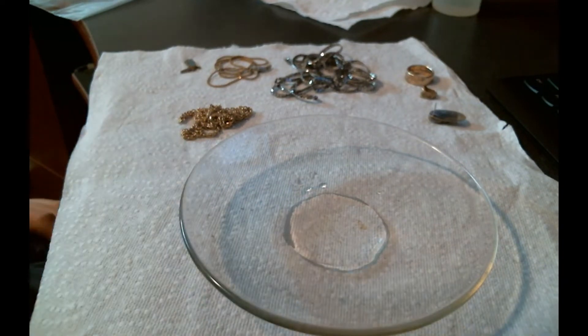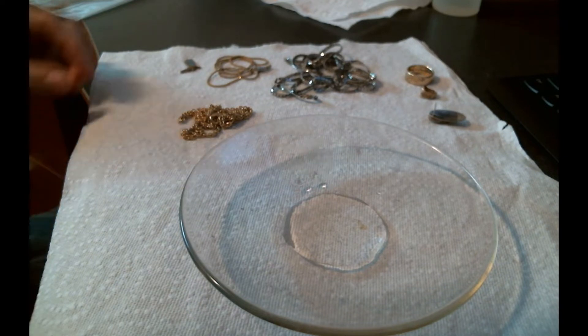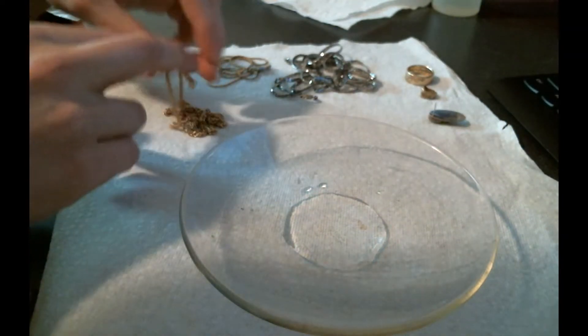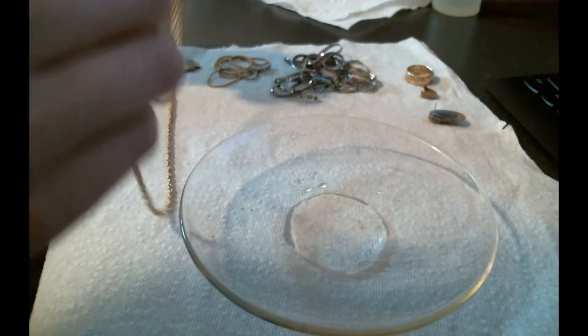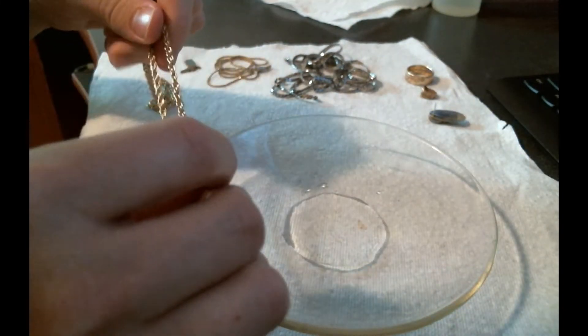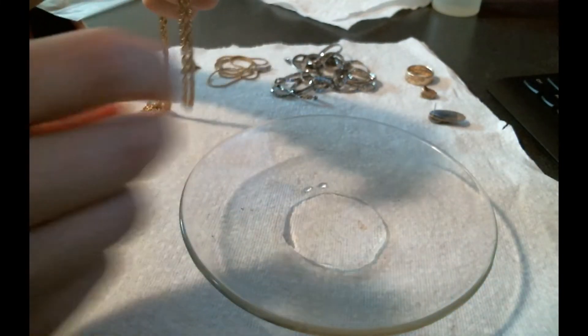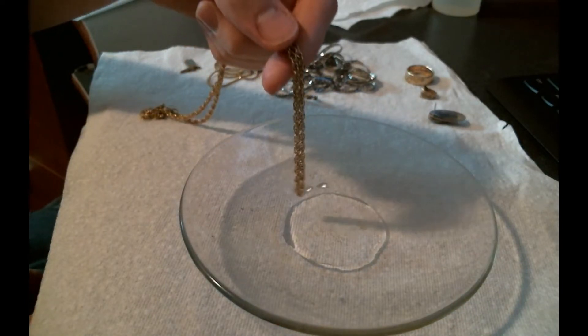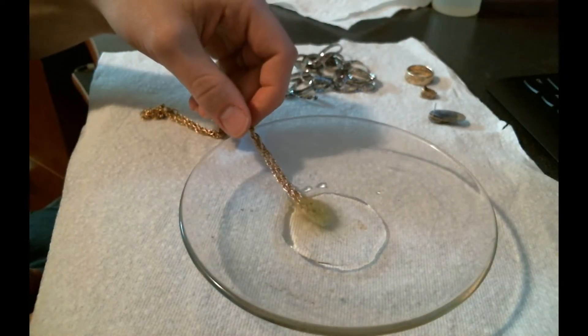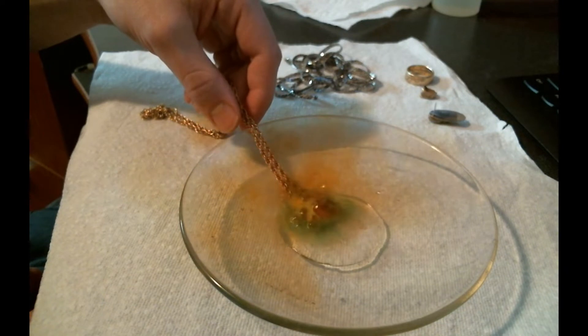Here's an example. This necklace is magnetic, so I would have filtered it out with a magnet, but it's gold plated. If I put it in here, you see you get a very vigorous reaction.